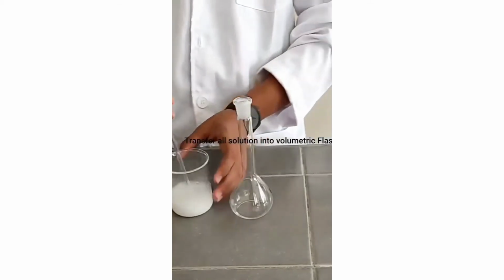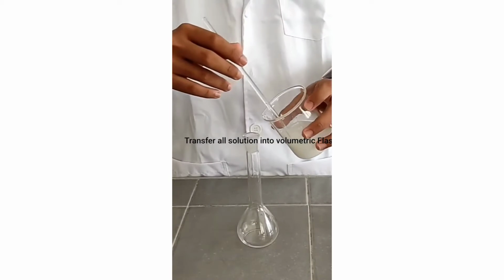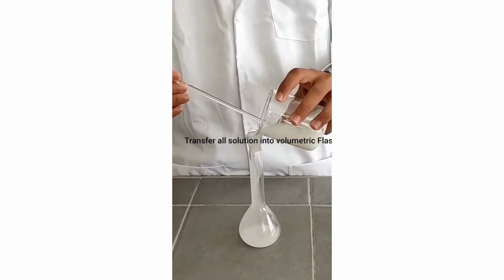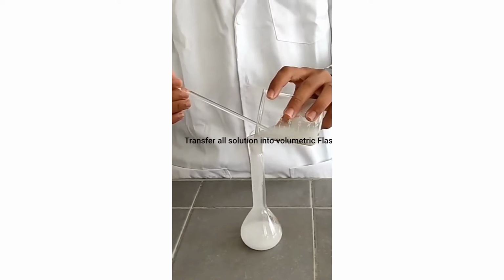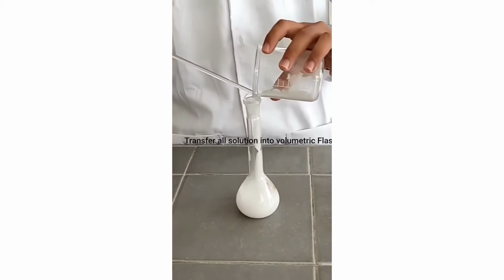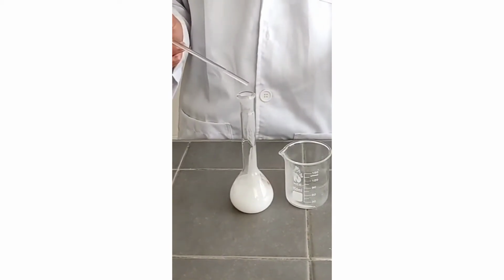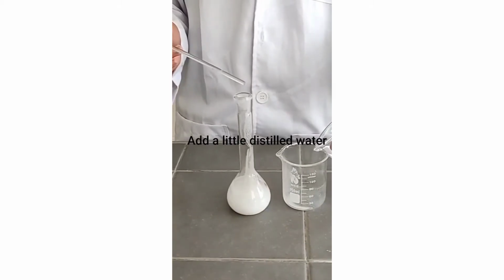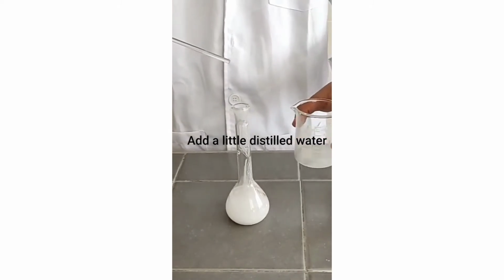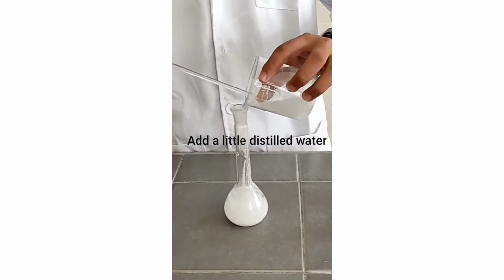After that we must transfer all the solution in the beaker into the volumetric flask. We will add some distilled water into the beaker to make sure all the solution is cleared and transferred to the volumetric flask.